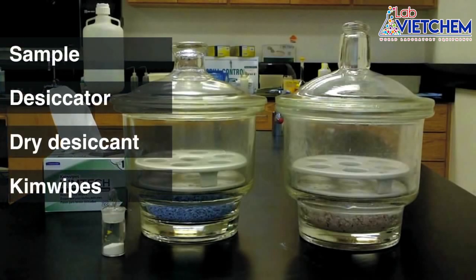A desiccator obviously, your sample, some dry desiccant, and maybe some kimwipes.